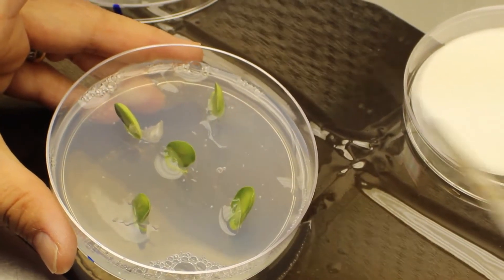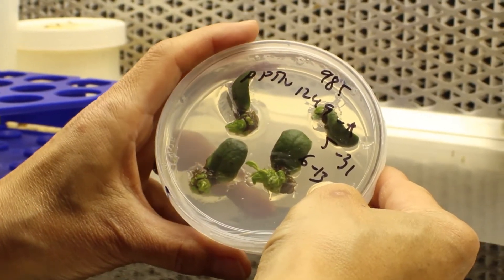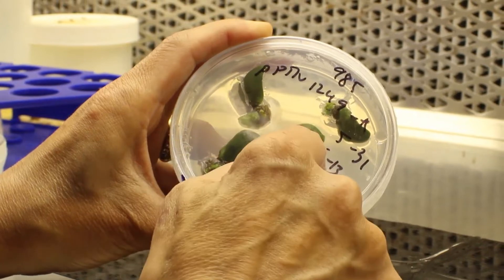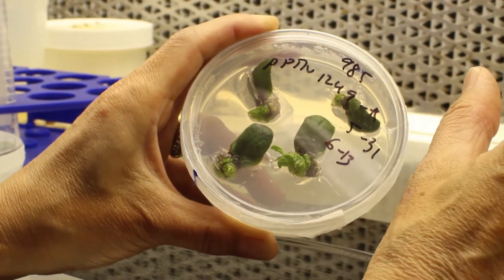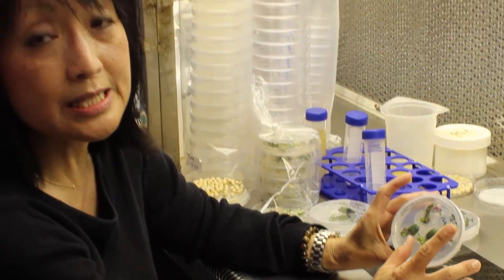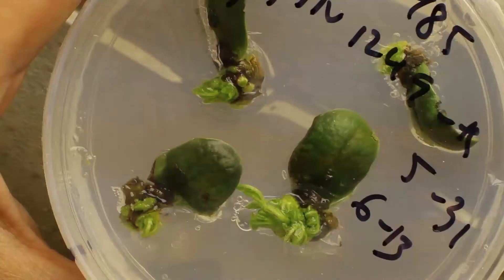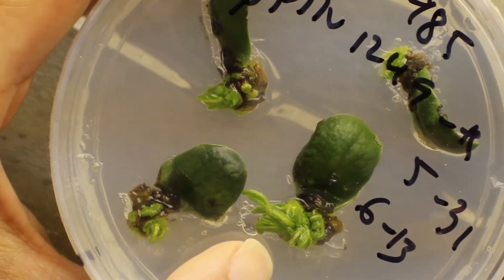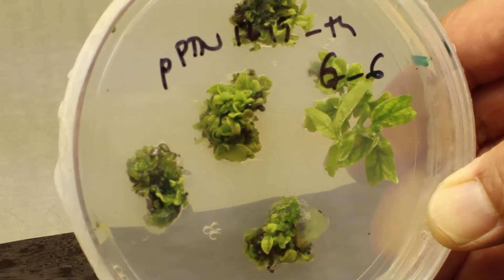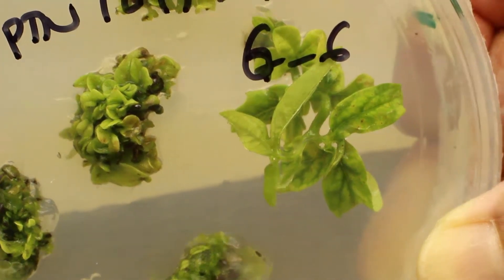If the single cell contains that new DNA, all the cells in the new plant will contain that new DNA. After two weeks, you can see what has happened to the cotyledons — we've started to see a cluster of new shoots being produced. The plant growth regulator in this media has altered the normal course of development, so instead of producing a single big plant, we've produced a cluster of buds. These shoots are our potential transformants.